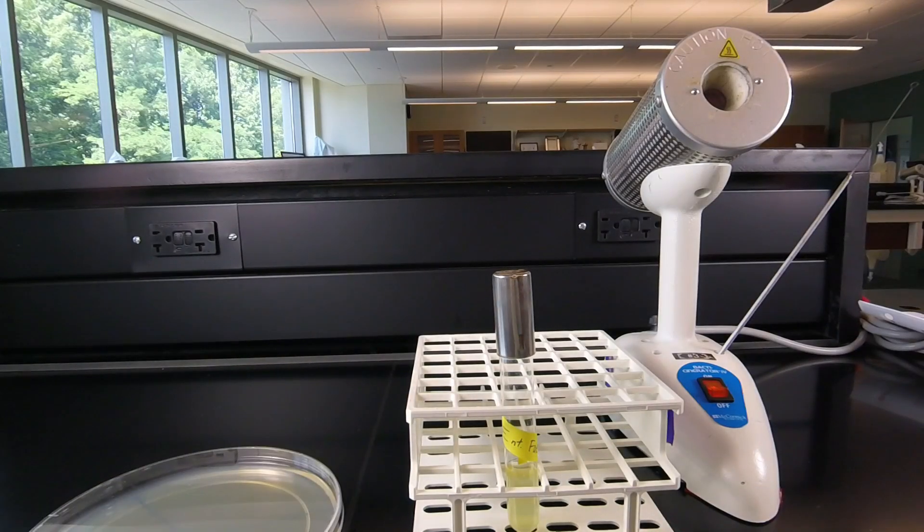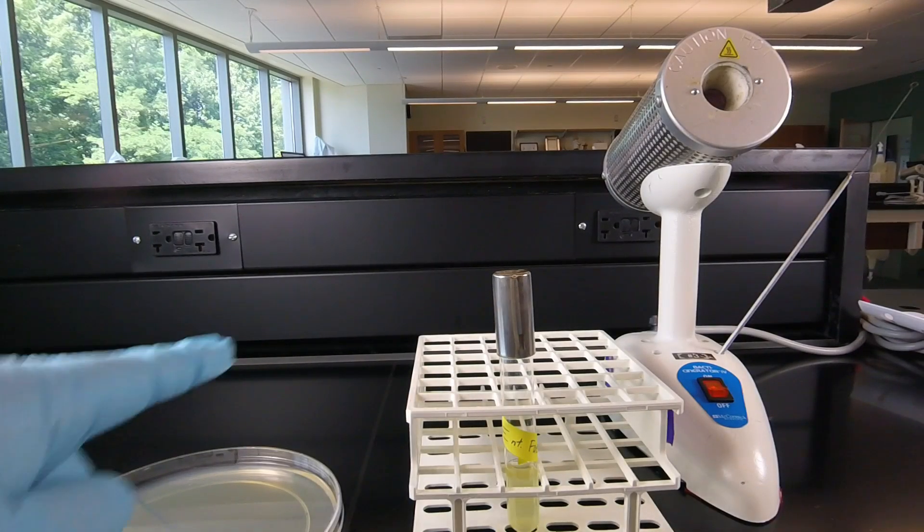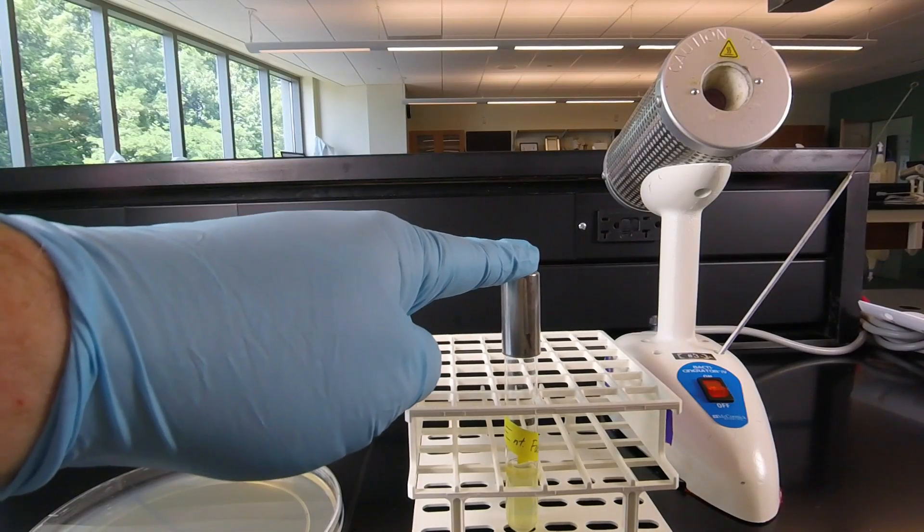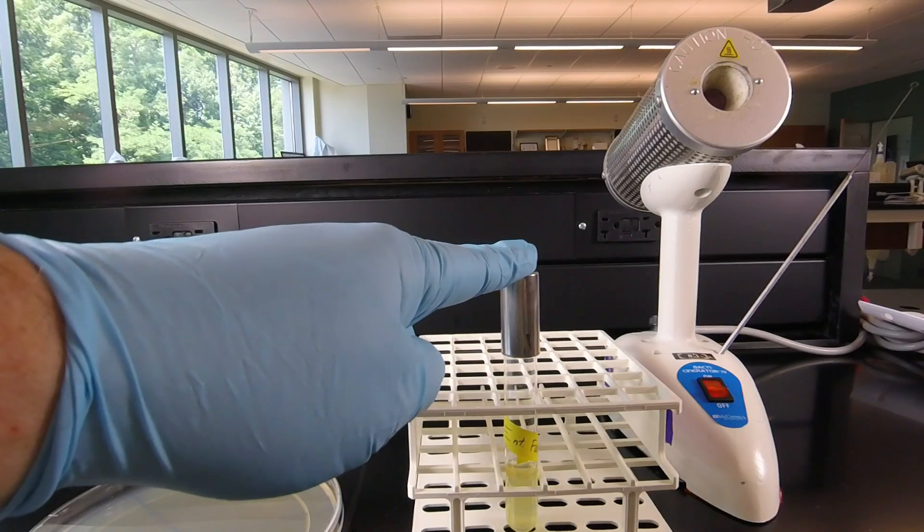So the first thing we have to do is inoculate the Mueller Hinton Agar with the organism we're testing. Now in this case, this is one of the bacteria we're using in today's lab, Enterococcus faecalis.